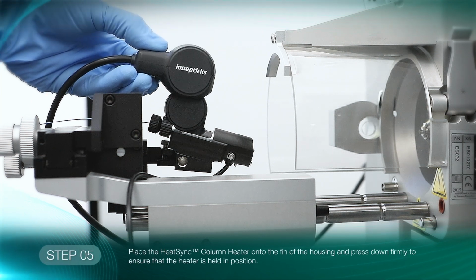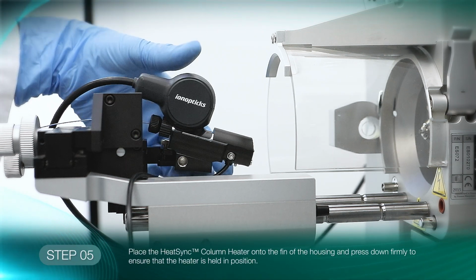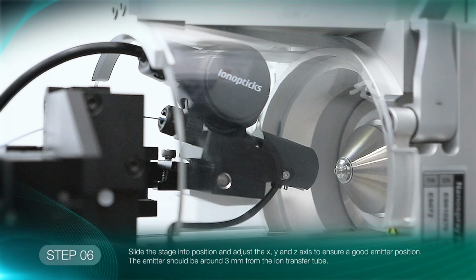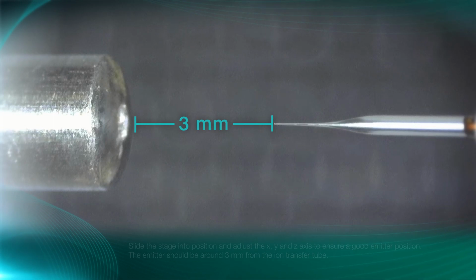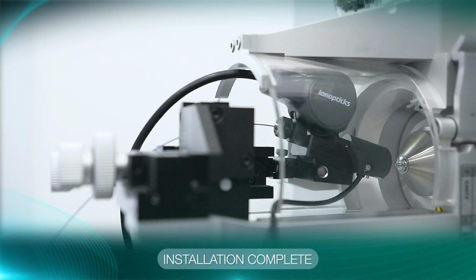Place the HeatSync column heater onto the fin of the housing and press down firmly to ensure the heater is held in position. Slide the source stage into position and adjust the X, Y, and Z axis to ensure a good emitter position. The emitter should be around 3 mm from the ion transfer tube. The HeatSync housing and heater are now installed and ready for operation.